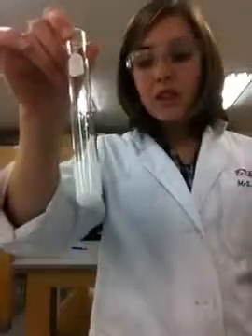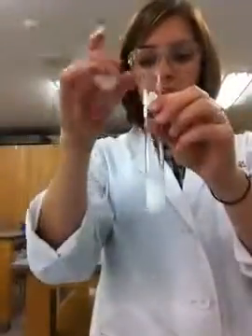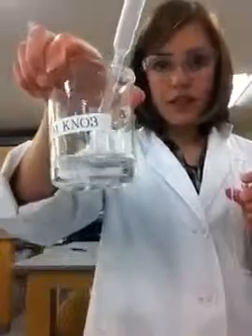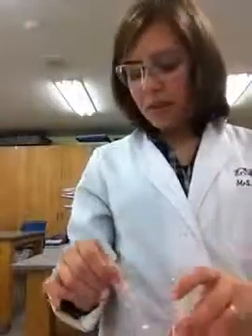So you've got to be really careful here. The difference between chloride and sulfate, they're both producing white precipitates. And finally, in our last test here, we have our nitrate with potassium nitrate, and we begin by putting about 3 milliliters into our test tube.